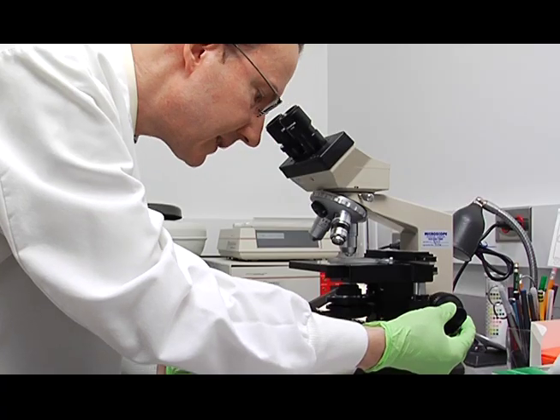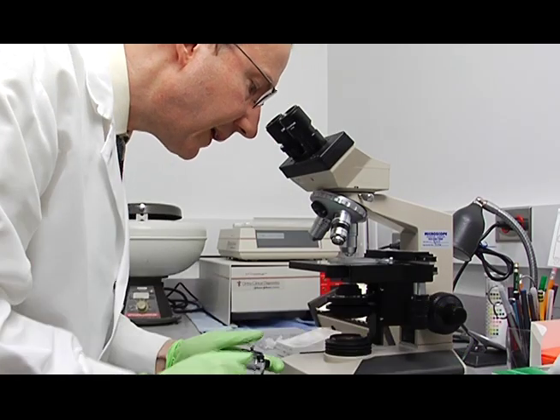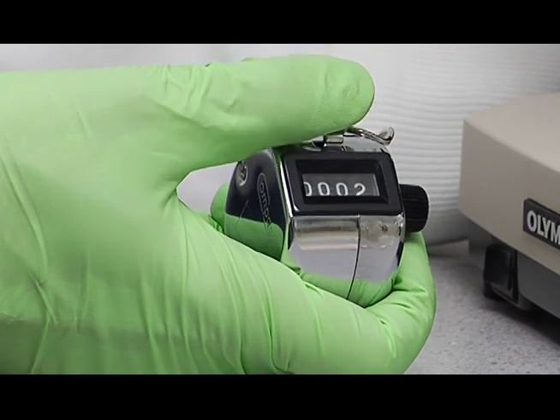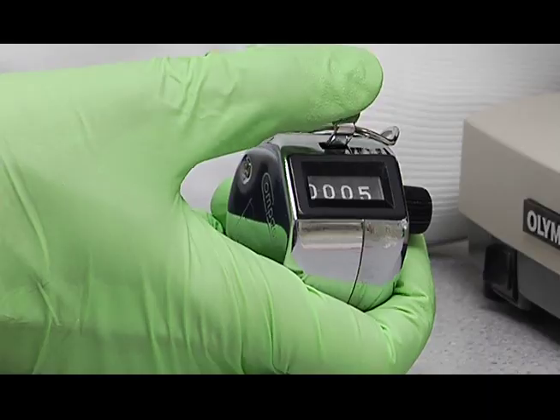As you count the cells, keep track of them on a hand tally. You may need to adjust the focus as you count.